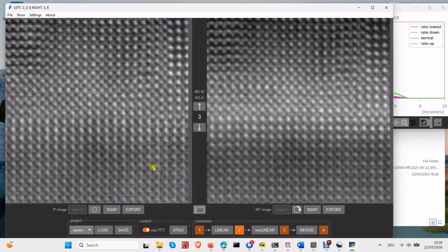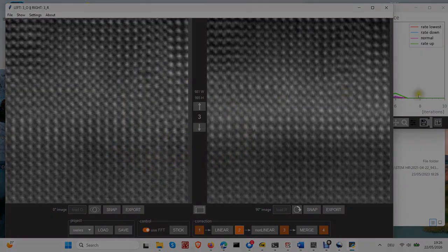This video concludes a set of 4 short tutorials introducing TEMDM STEM Corrector. The software is under continuous development, and new features are being added. And of course, if you notice any incorrect behavior, please report it.